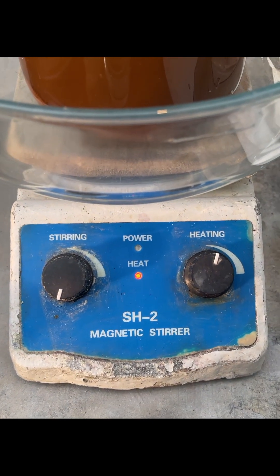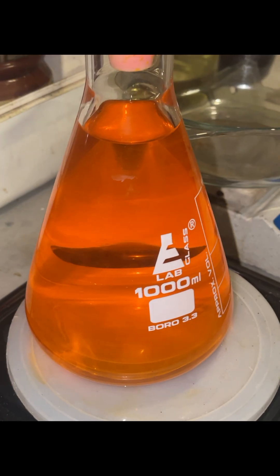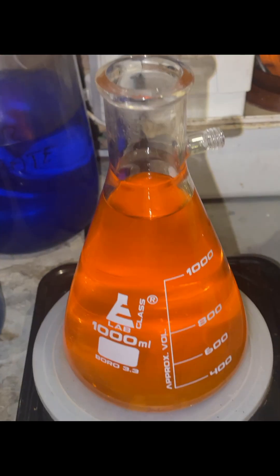Got the heat about halfway. Look at the color of that — it's all in solution. We've got over four ounces of gold in there. I'm going to filter that now using cotton to filter it. That's filtered — crystal clear, that's beautiful. Put that in a beaker.